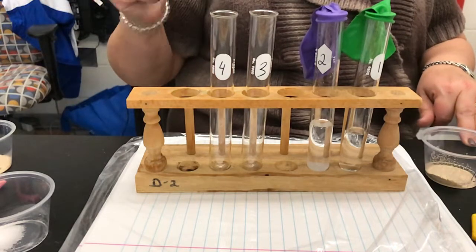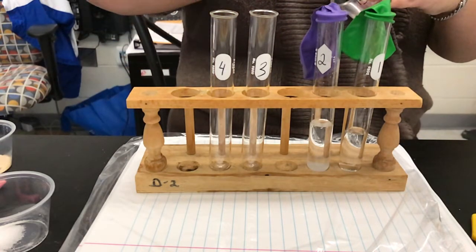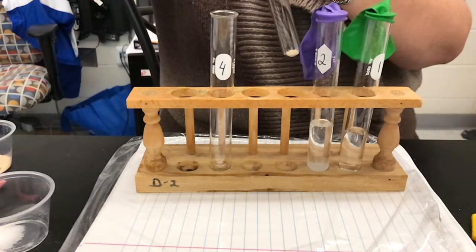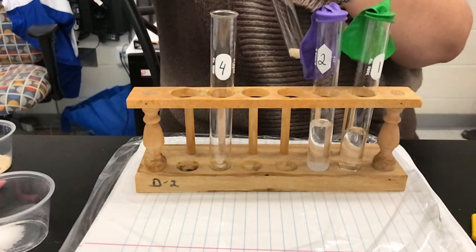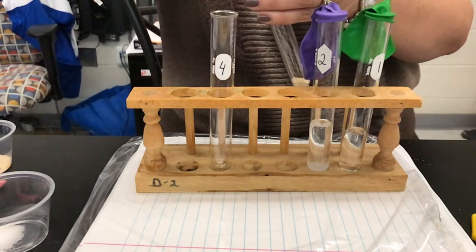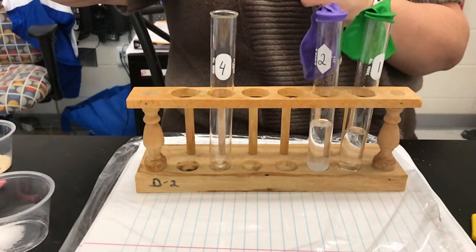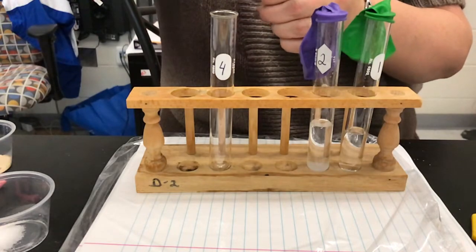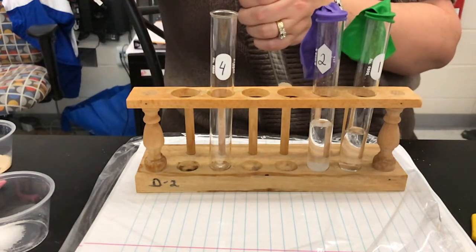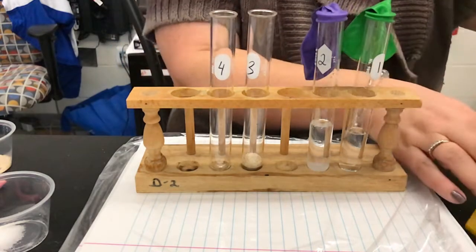Same thing — you can flip-flop them. Now our third one asks us to put in our yeast. It's very static-y right now, so we're going to put in our one gram of yeast. I'm going to put the yeast in first. All right, that's about our one gram of yeast.